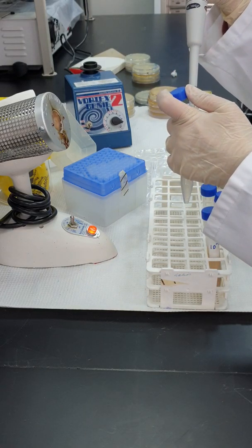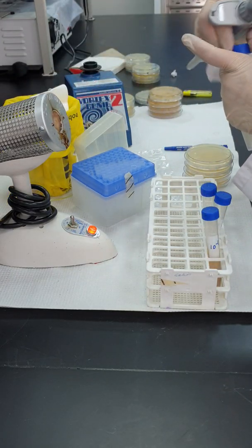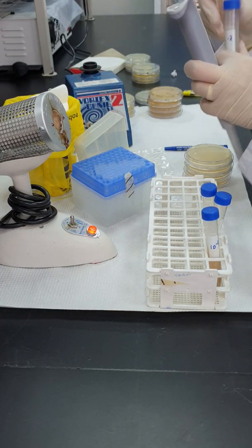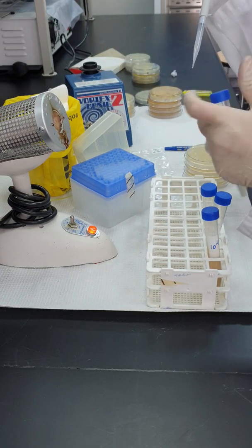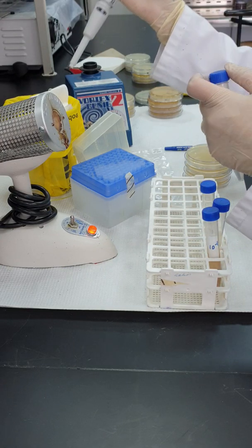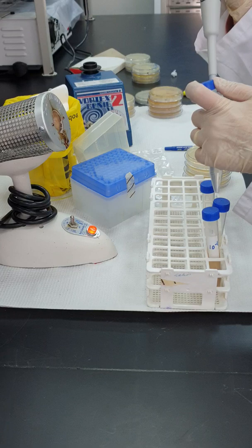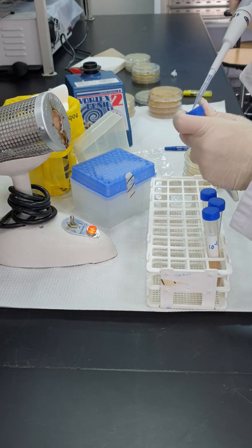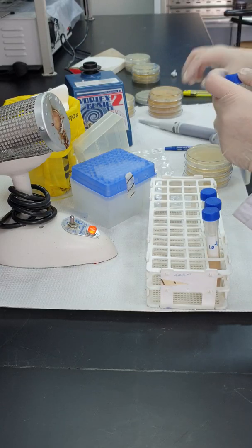When we are performing serial dilution, we need to change the tip, throw it in the hazardous waste after each step. Even the second test tube, it's better if you vortex it. I transfer from the second to the third. No need for vortexing here, simple mixing is enough. And then from the third to the fourth. I prepare as many test tubes as I want, depends on my experiment. So this is 1 to 10 serial dilution, and it is done. I will continue with the process.